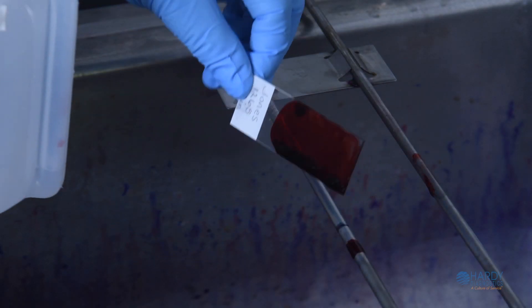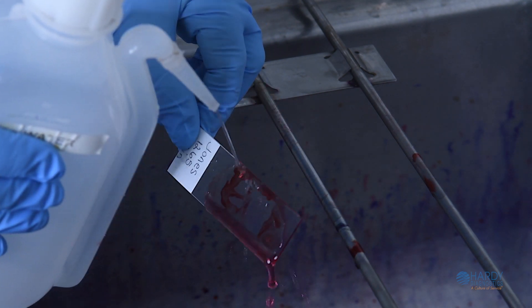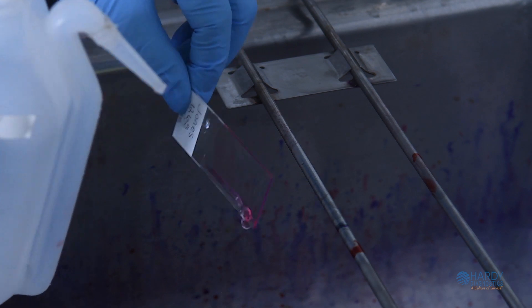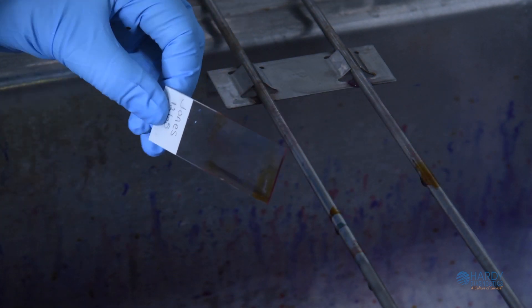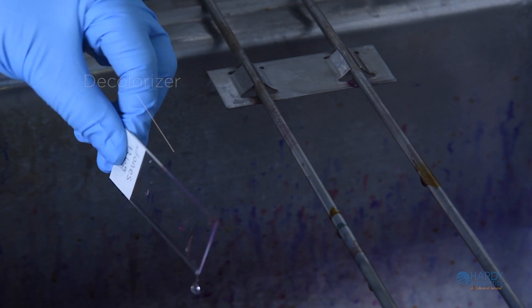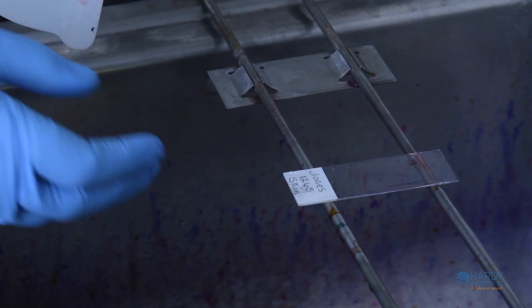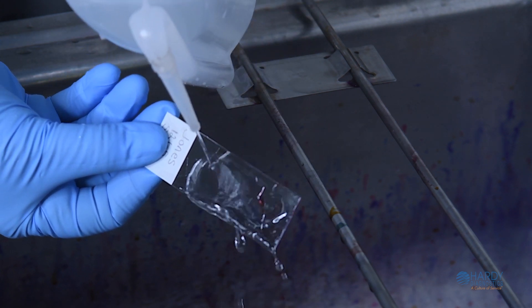Once one minute is up, rinse off the Gram's iodine with deionized or tap water. Then tilt the slide at an angle over the sink or tray and add the decolorizer drop-wise until the violet color stops running. When the solution runs clear, immediately rinse the slide with deionized or tap water to neutralize the decolorizer.